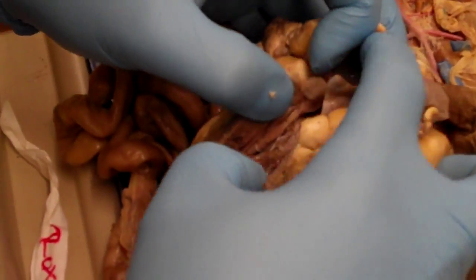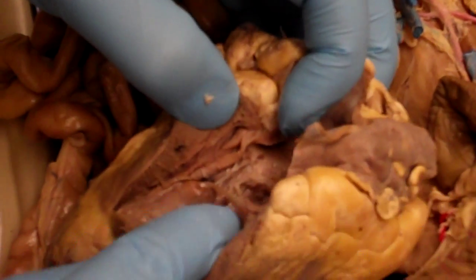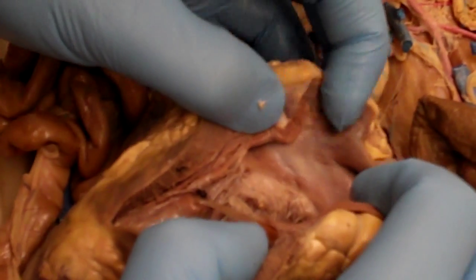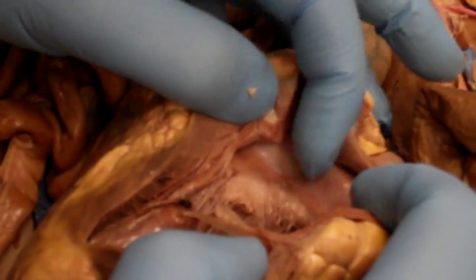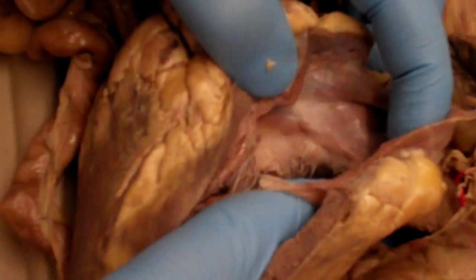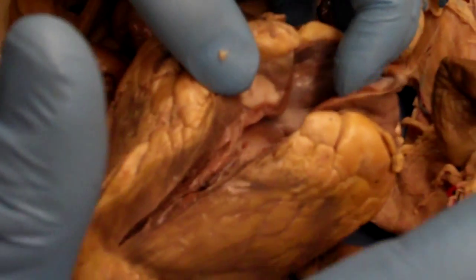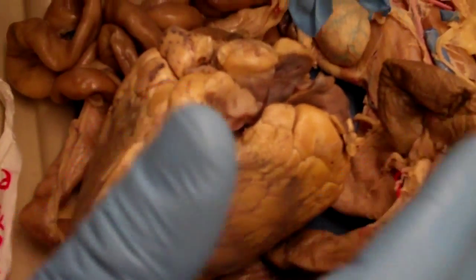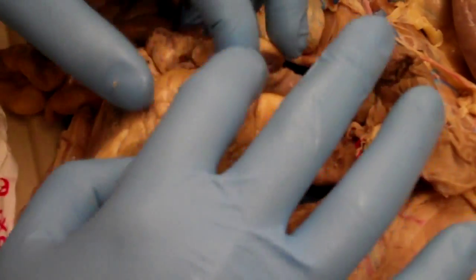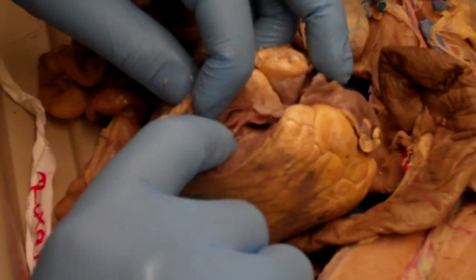If we flip over now to the right ventricle, this side's a little trashed, but we have the wall of the right ventricle right there. Again, we can see the smoother white interior, which is going to be the right atrium, and then we have remnants of that right AV valve, sort of by my finger. So the construction is really the same on both the left and right side of the heart. It's just the right heart is going to be smaller. It's going to be a smaller volume in the right ventricle, and the wall thickness is going to be smaller.